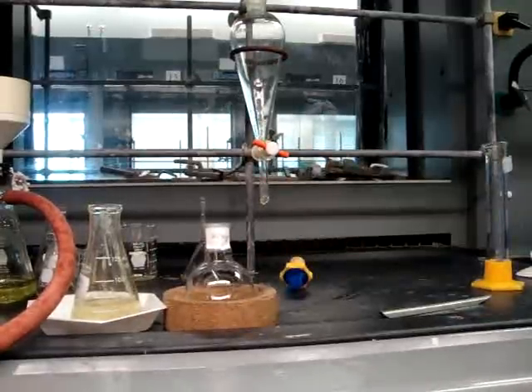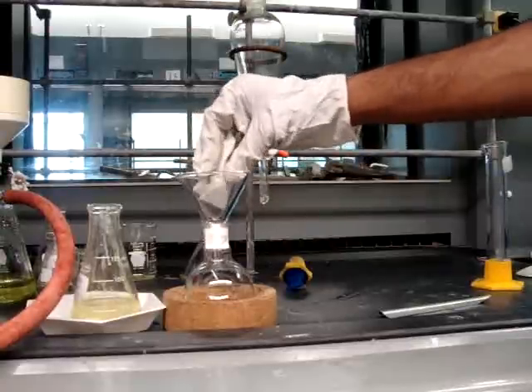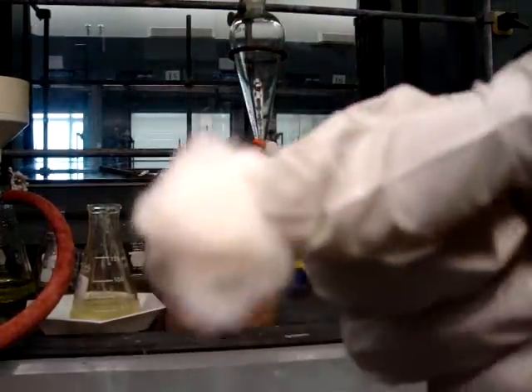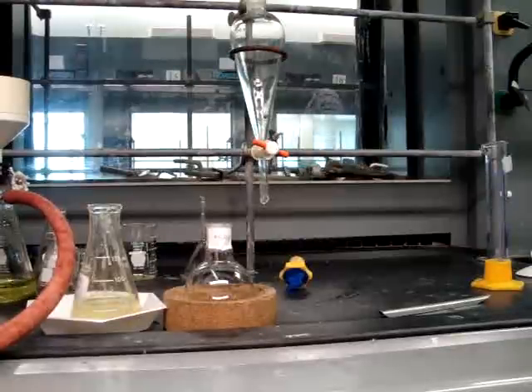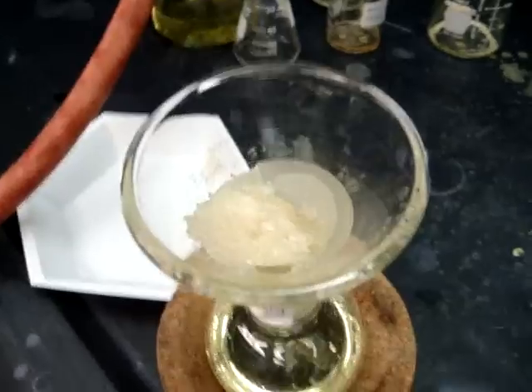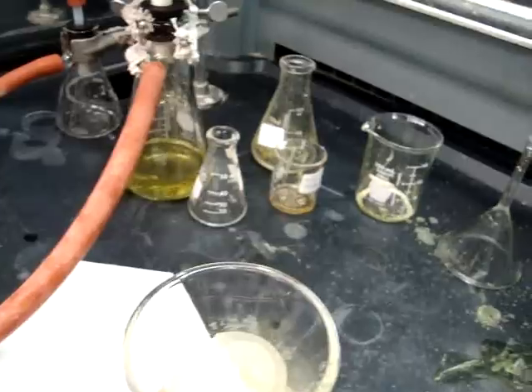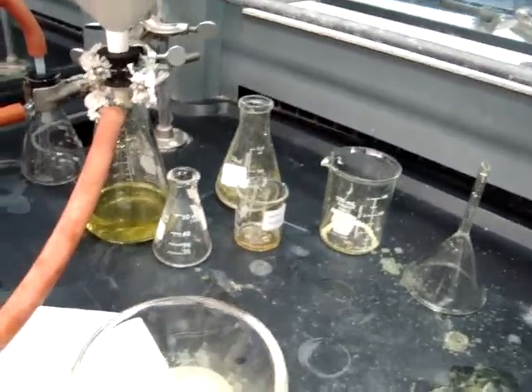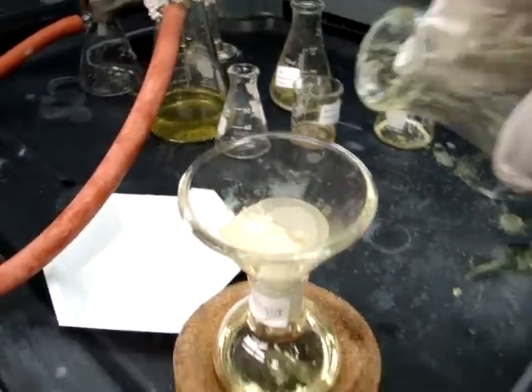When you are going to filter through the organic layer, you'll need to put the filter into the round bottom flask and filter paper, which will use dichloromethane, the organic solvent, to stick it to the side. Then you'll be putting a cotton plug in the funnel — just use your finger to stuff the cotton plug down into the funnel. The solid lays on top of the filter and the liquid will go through into the bottom. You can rinse your filter with dichloromethane to make sure that you remove all of the solution from the flask and from the solid on the top of the filter.